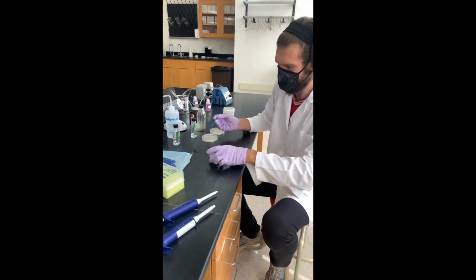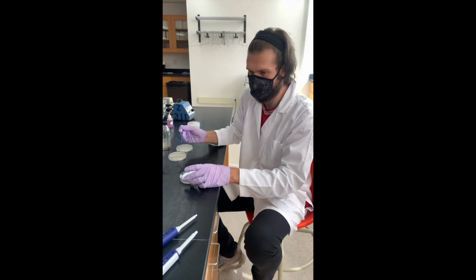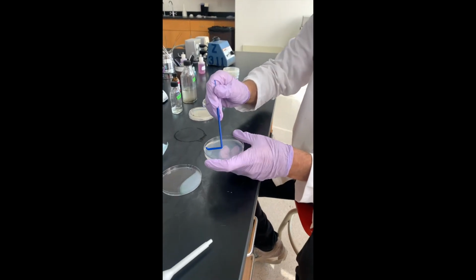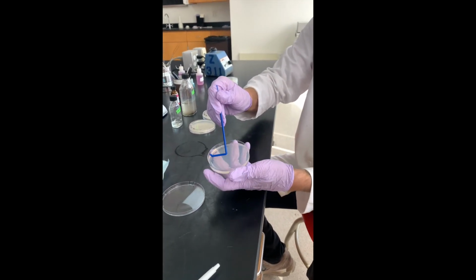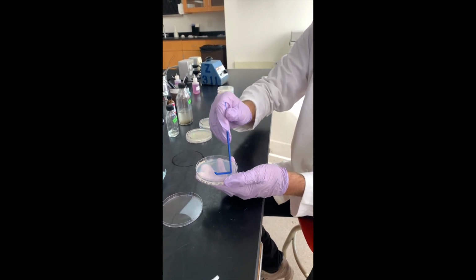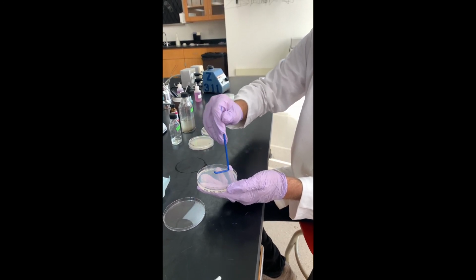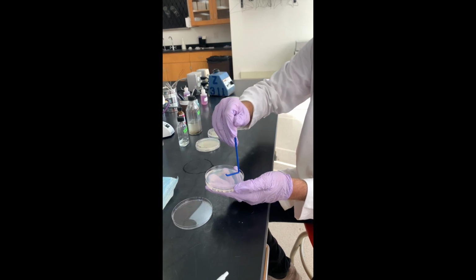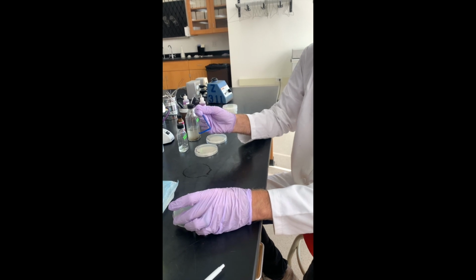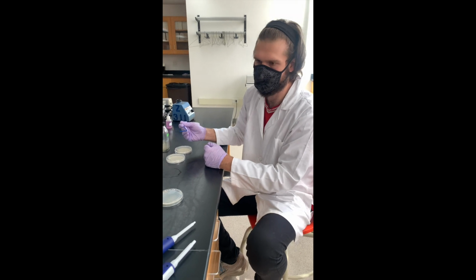So we'll be spreading the dilutions out on our plate with these sterile plastic spreaders. Sometimes I call them hockey sticks. So what you do, you've got your dilution in the middle there, and what I like to start off doing is just kind of rotating the plate like so, which spreads it kind of all the way across, and then you can go kind of back and forth with the hockey stick. Basically, the biggest point is that you spread the culture all over the plate. So we're trying to get a lawn of growth here. So now, once that's spread across, we can move on to the others in the dilution series and spread them the same way.